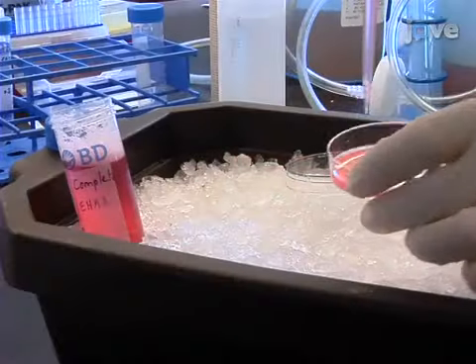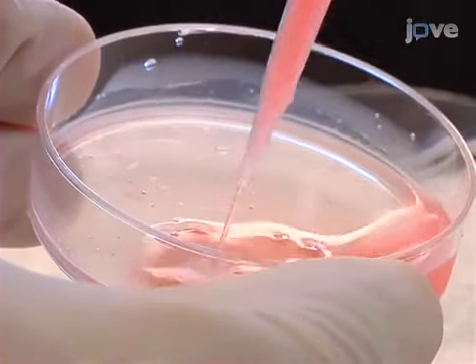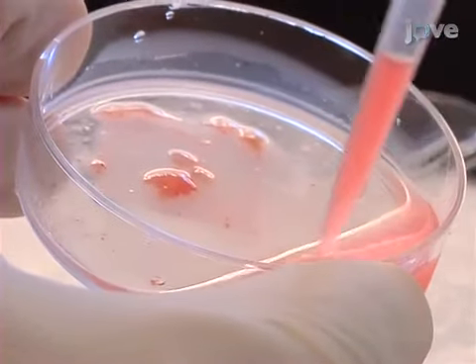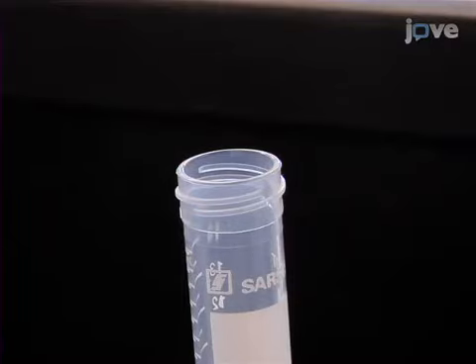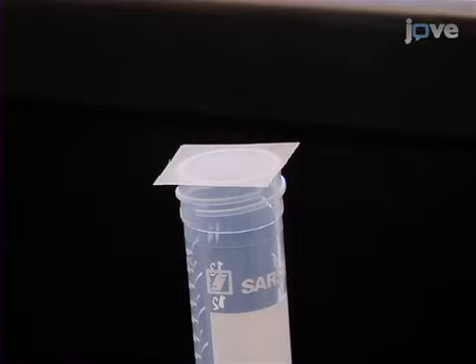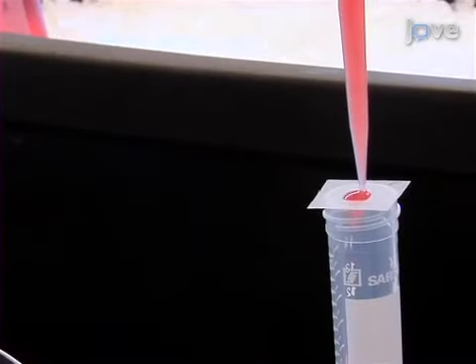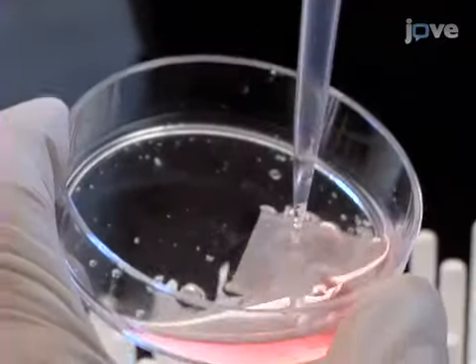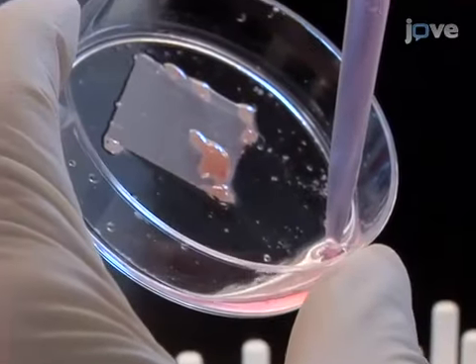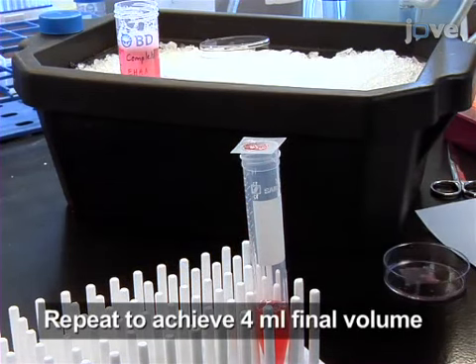Add another milliliter of media to the dish and then pipette the solution up and down to work the cells into a suspension. Now, place a new nylon mesh on top of a fresh 15 milliliter polypropylene centrifuge tube and then transfer the cells through the new mesh. Rinse the dish and mesh with another milliliter of cold media and pool the volumes through the new piece of mesh into the 15 milliliter tube. Repeat the rinse one more time.